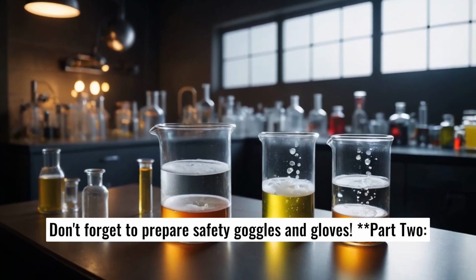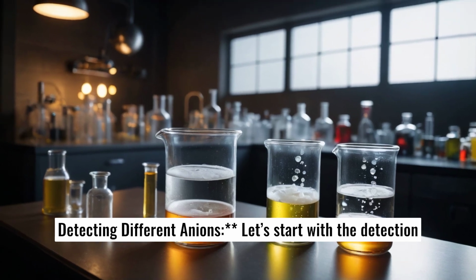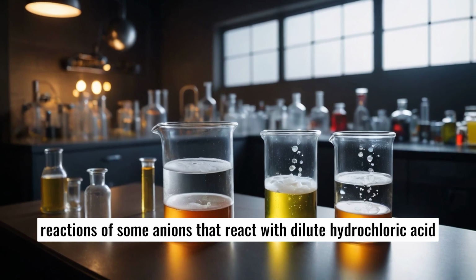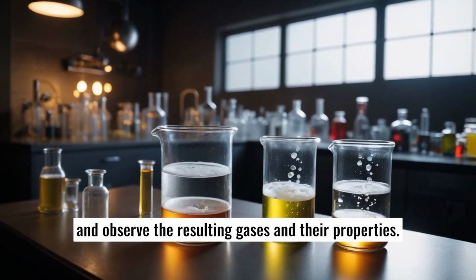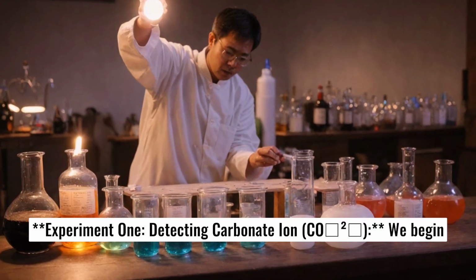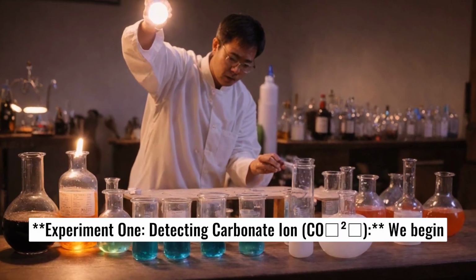Part 2. Detecting different anions. Let's start with the detection reactions of some anions that react with dilute hydrochloric acid and observe the resulting gases and their properties. Experiment 1. Detecting carbonate ion, CO3 2-.